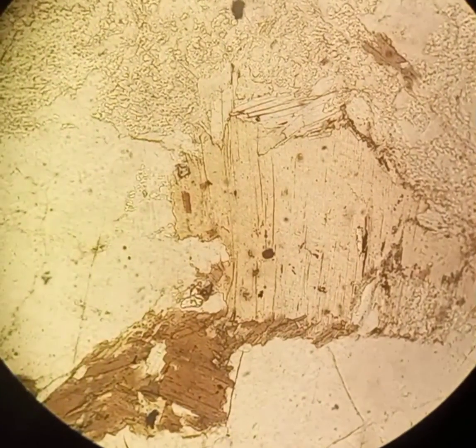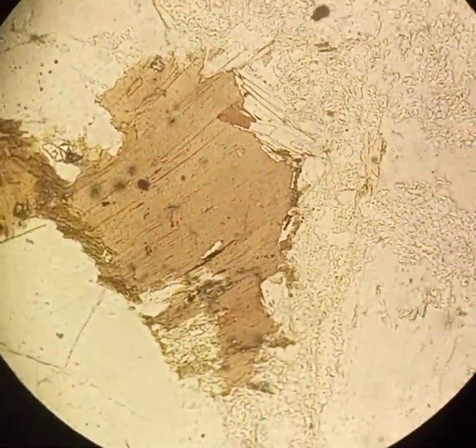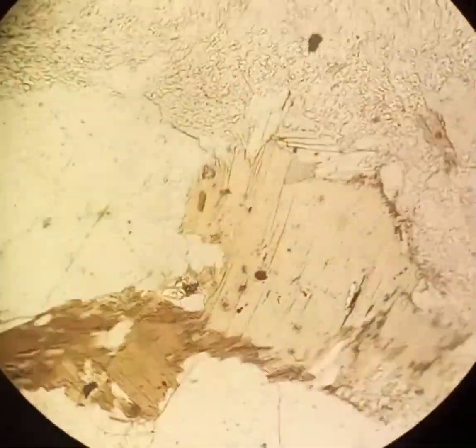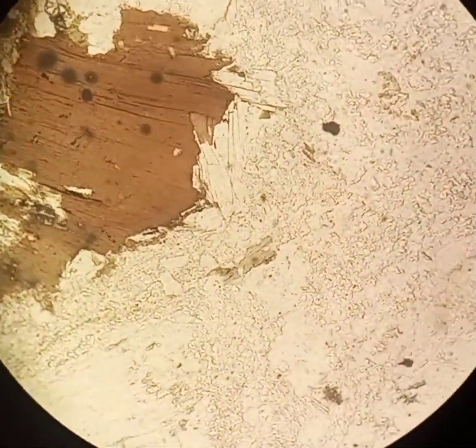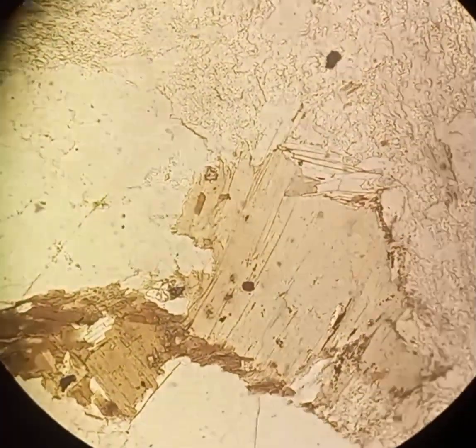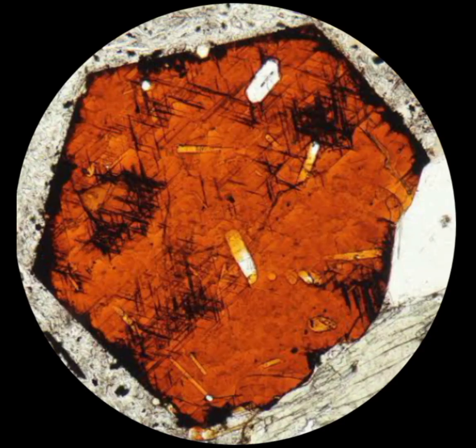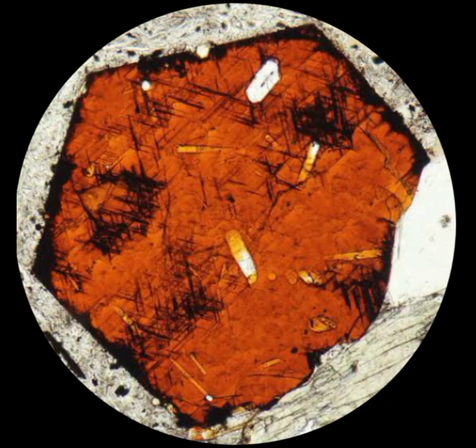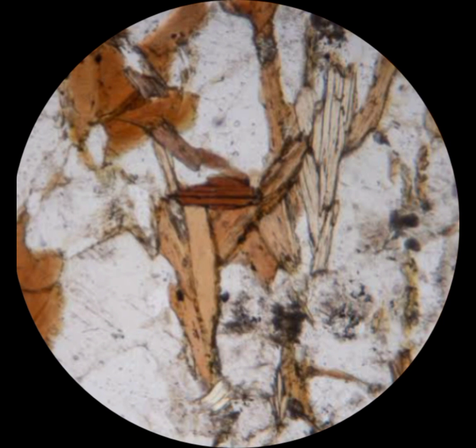In plain polarized light, it has moderate positive relief. It is a pleochroic mineral that changes its color from light brown to dark brown on the rotation of the stage. Sometime it gives brownish green or reddish brown color in plain polarized light due to the presence of iron in the biotite crystal.